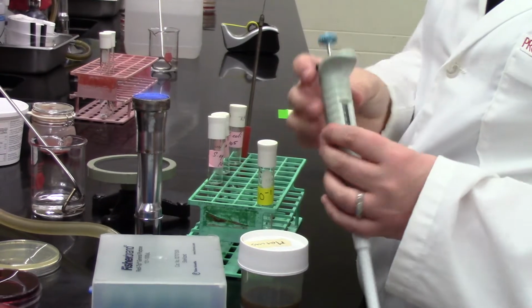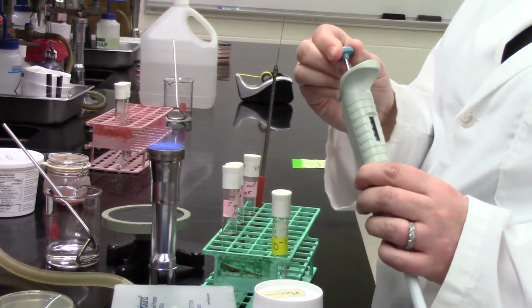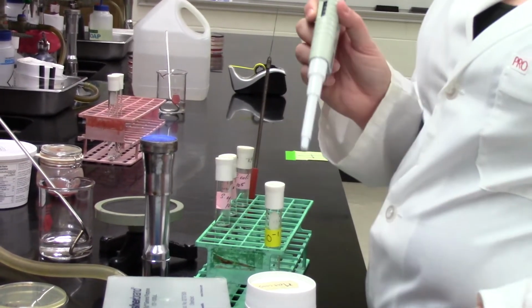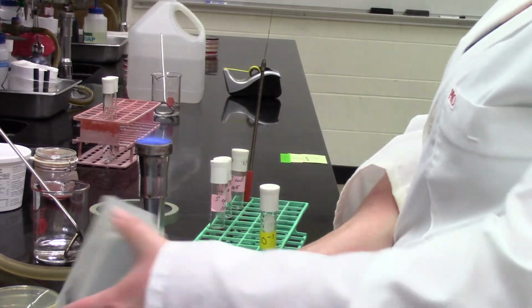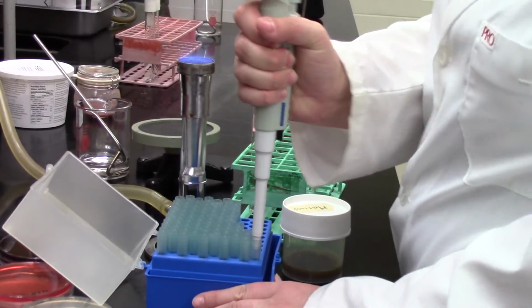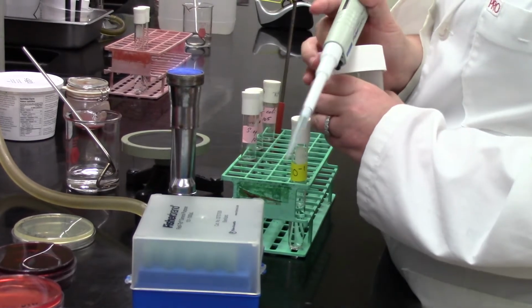At first, you're not going to be able to turn that blue dial, and that's where that lock comes in. So you need to unlock these micropipetters first, then adjust the blue dial until you see 1000 in the window, which indicates 1 ml on these micropipetters. And then you can get your tip on, right? So she's getting the tip on, making sure that box stays closed until she's ready to open it, closing it up as soon as she's got that tip out.